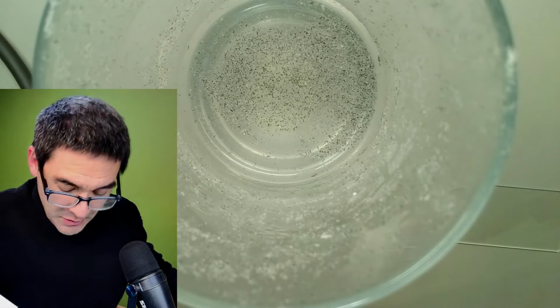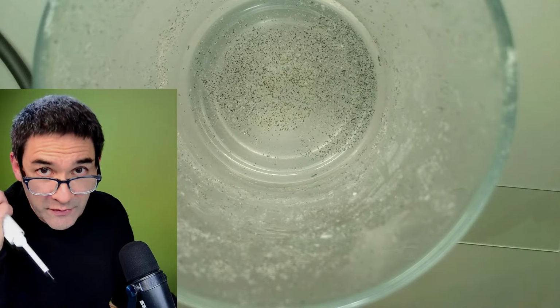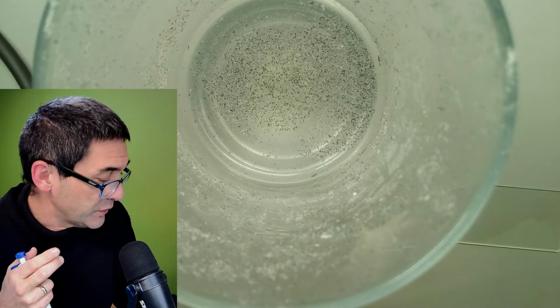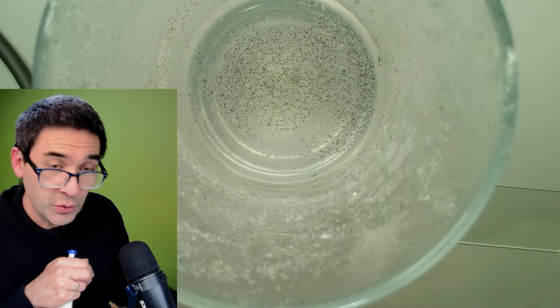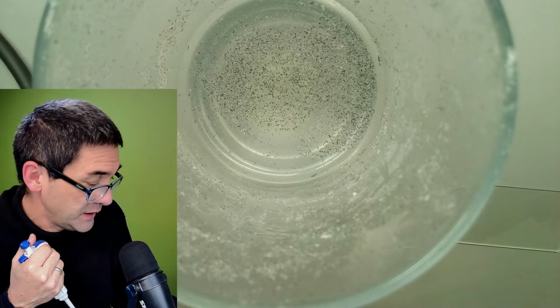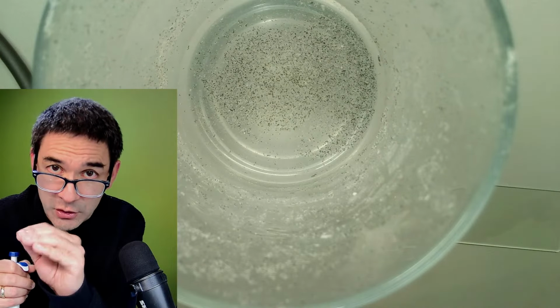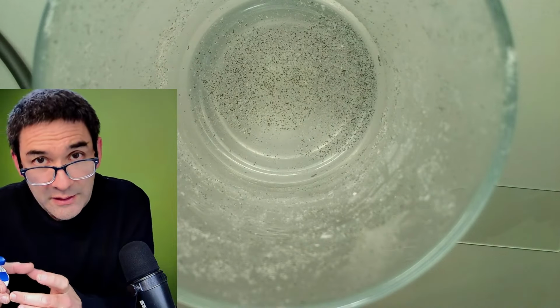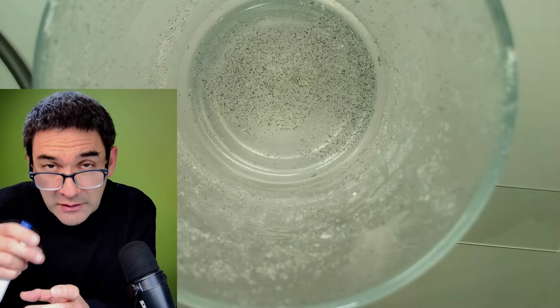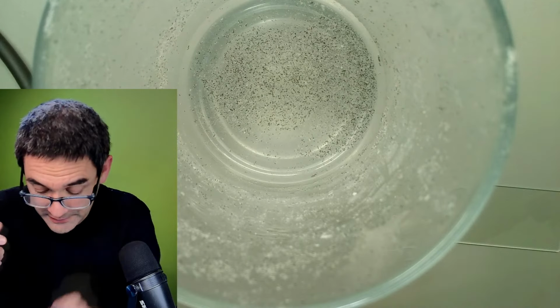Why am I doing this? Because last week there was a request to look at the cross section of a hair, and that is very difficult to do, because then you have to embed the hair and then you have to microtome it. But when you shave yourself, if you're lucky, and because I've seen this already, then you might actually get a disc of hair with a top view, and then you're actually able to see the central canal of the hair. I hope that this is gonna work.